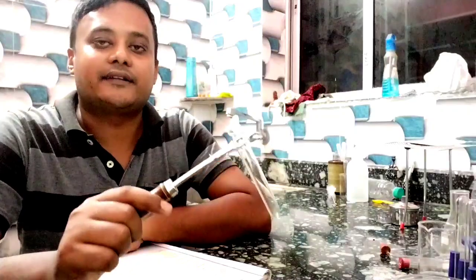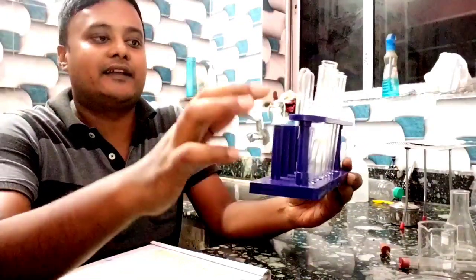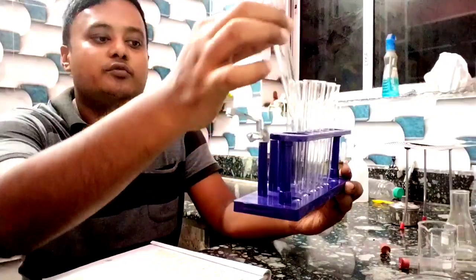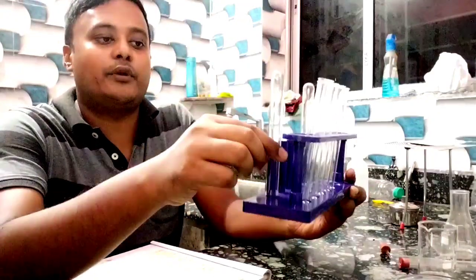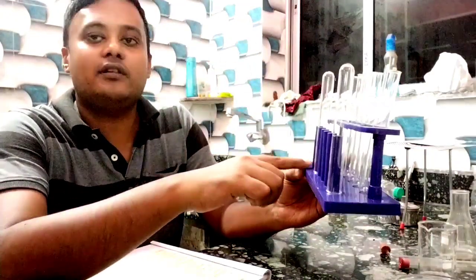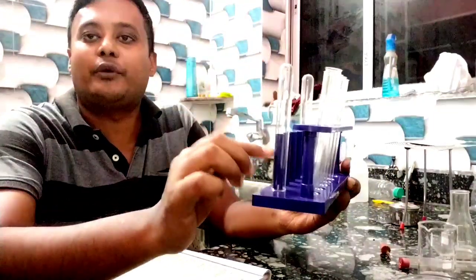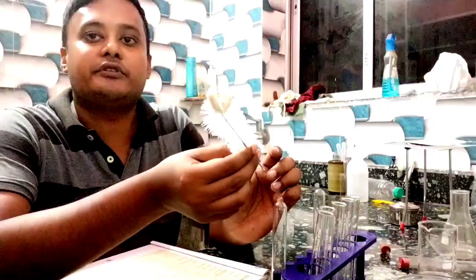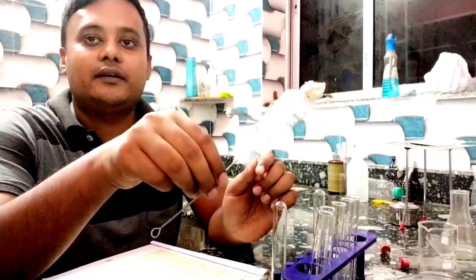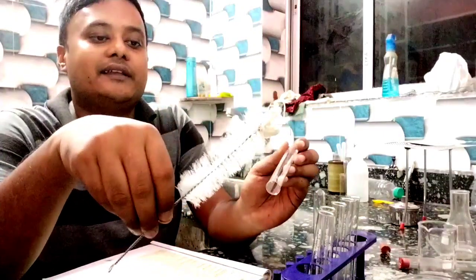Next one: test tube stand. There are pegs and holes. Dry test tubes we put in the holes, and after washing, wet test tubes we put on the pegs for drying. For cleaning, we use a test tube brush — it is a narrow brush specifically used to clean the inside of a test tube.